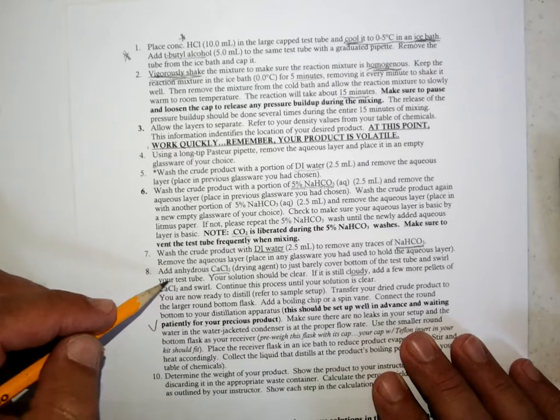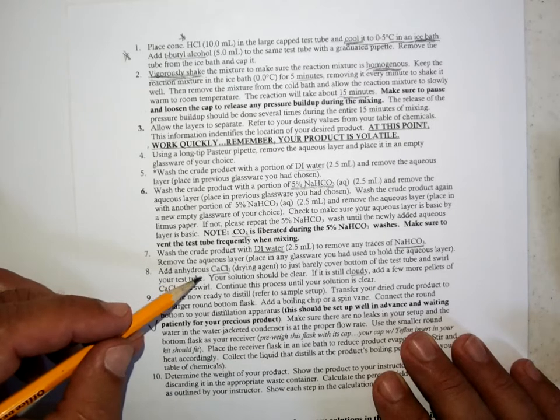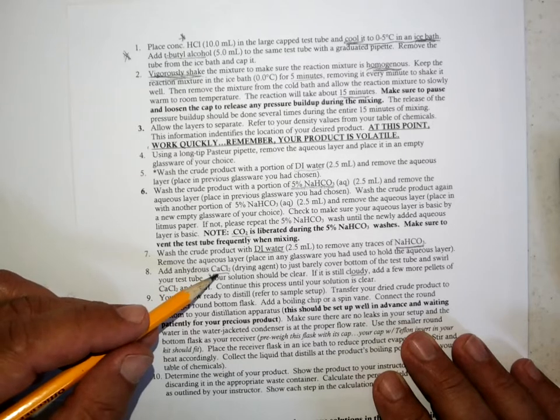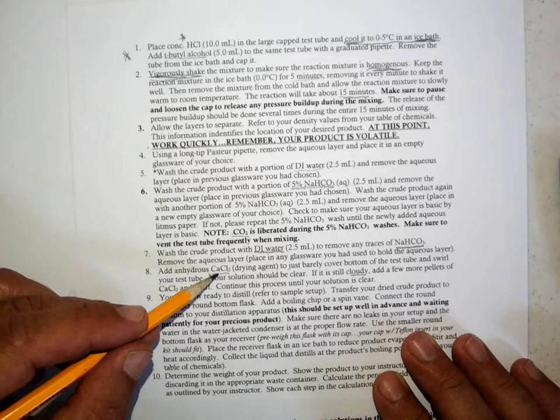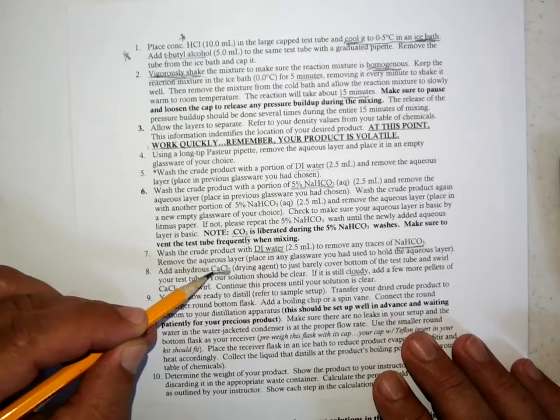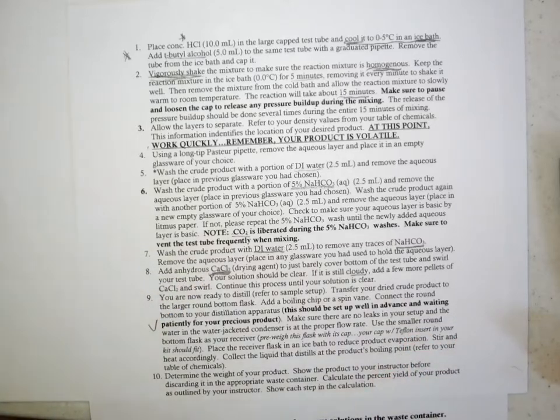I often would add in a step to transfer your organic layer into a dry test tube to make sure there's no large drops of water adhering to the test tube or reaction vessel that you've been using, because the calcium chloride isn't going to handle large drops of water. It's only going to handle trace water. So then you make sure you add your drying agent to remove the trace water that's dissolved in the solution or floating around in the solution.